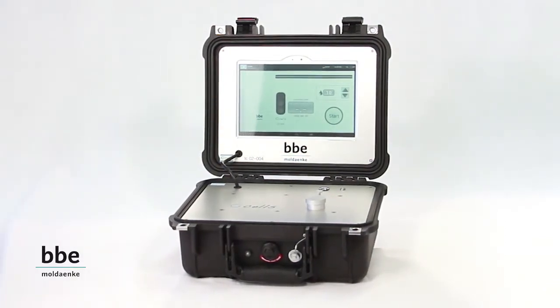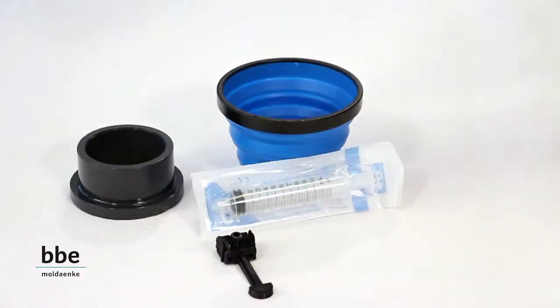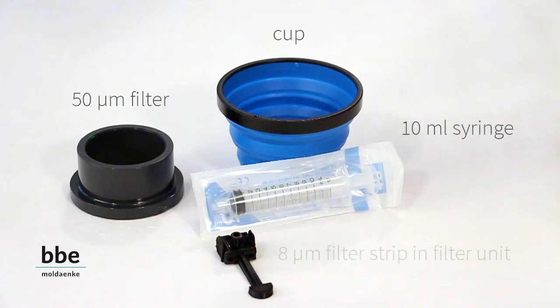Let's see how easily a measurement with TenCells can be performed. This is all you need for a measurement. Of course you also need a ballast water sample and a TenCells device.